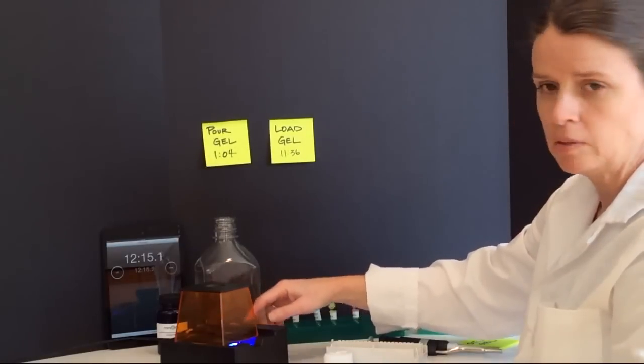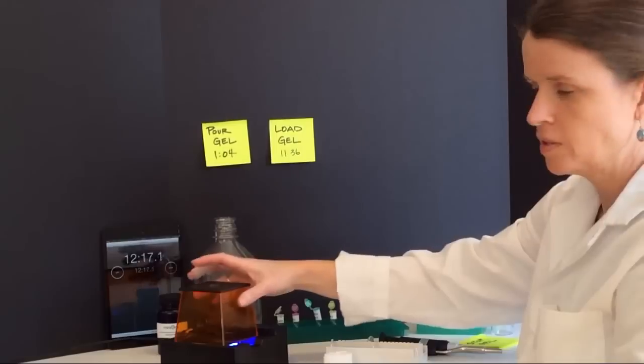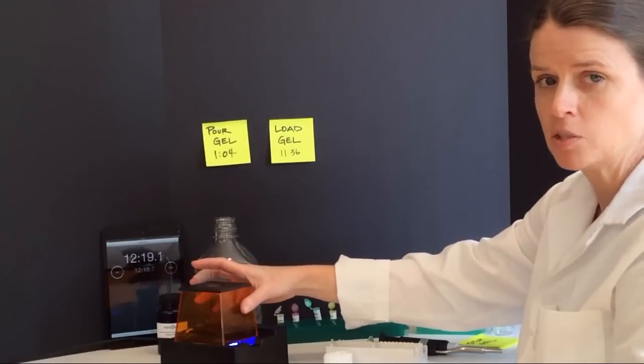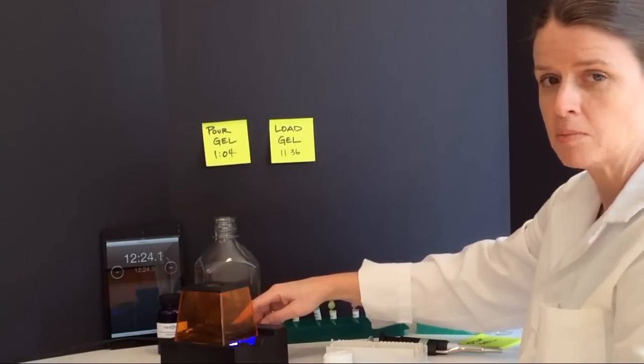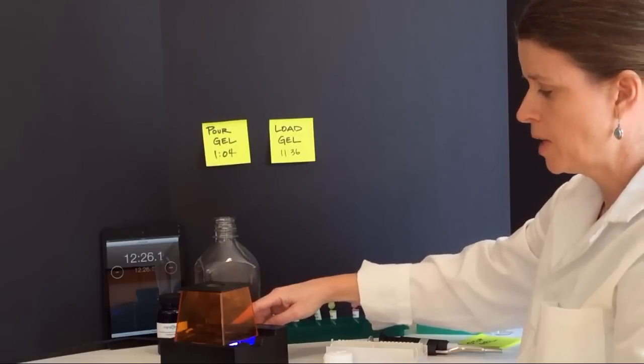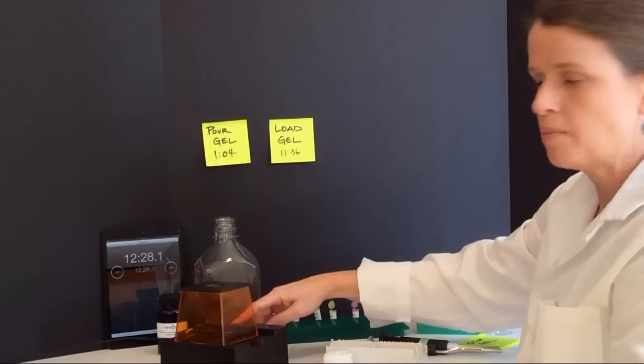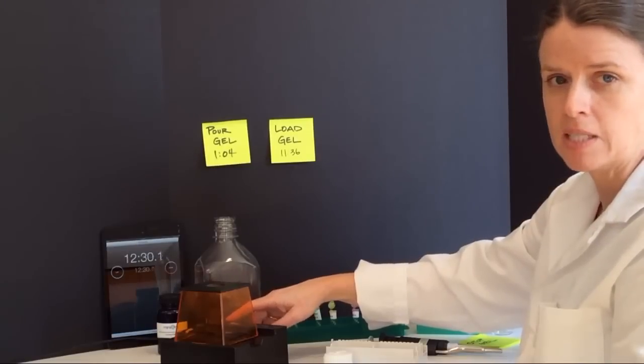I'll be able to run my gel here for approximately 20 to 25 minutes. Because I have the blue light here and I also have the filter of my top, I'll be able to visualize my DNA as it runs. I don't want to leave my light on the whole time though because I can photobleach my DNA sample. So I'm going to turn my light off and check back in a few minutes.